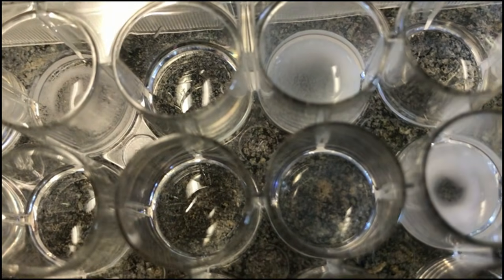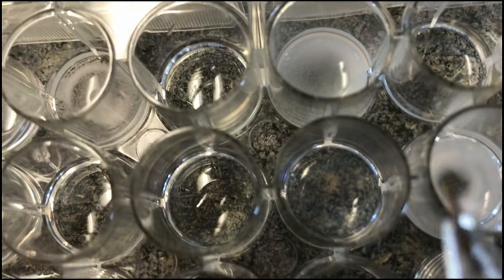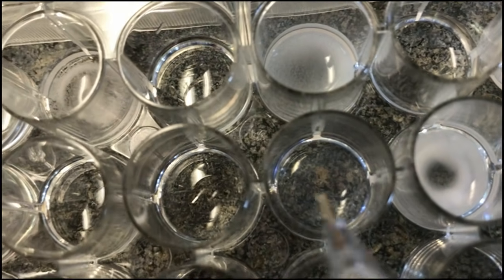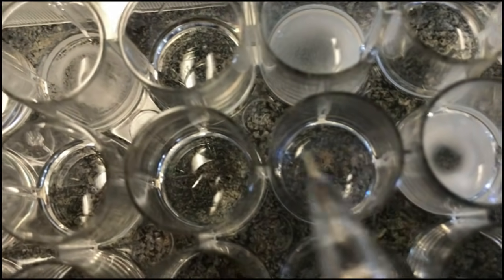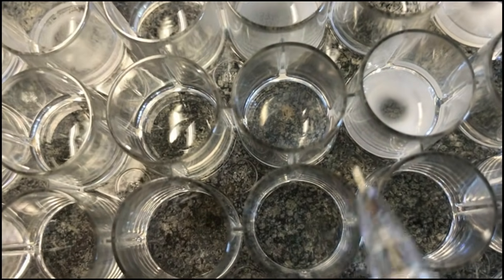Again, like before, if you notice from the other side, sometimes you can compare it. If you compare it to this one over here, it's nothing. But if you compare it to one that we know has not had a reaction, like row 3, then it is different, and it's different from the empty one below it.